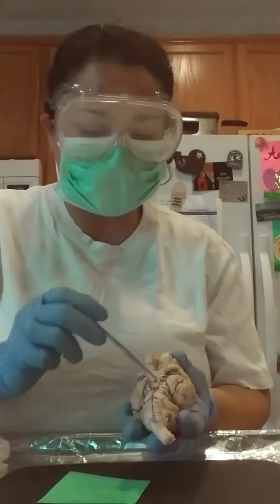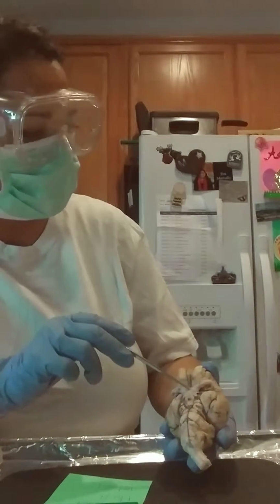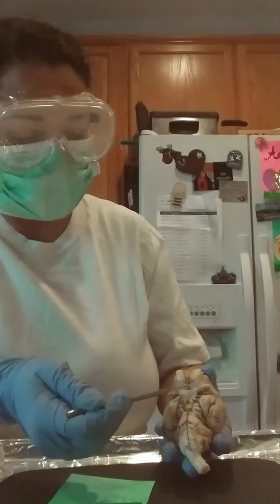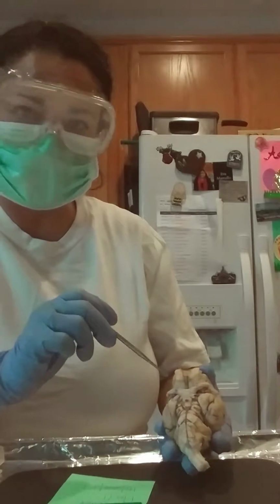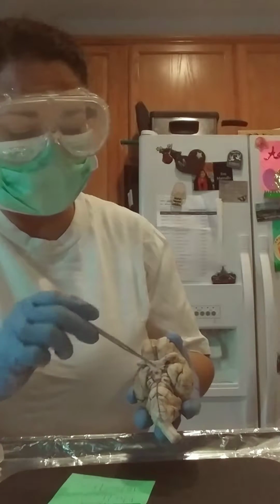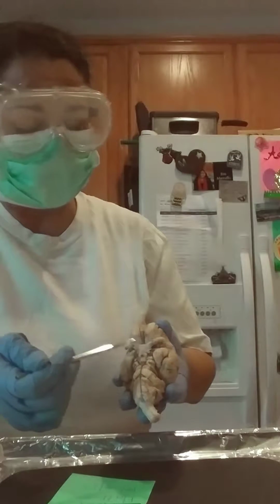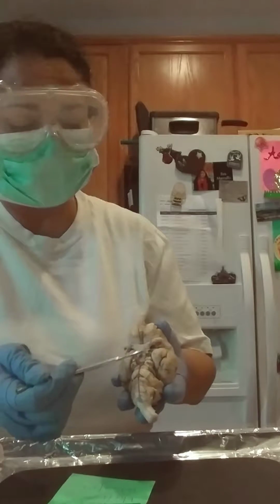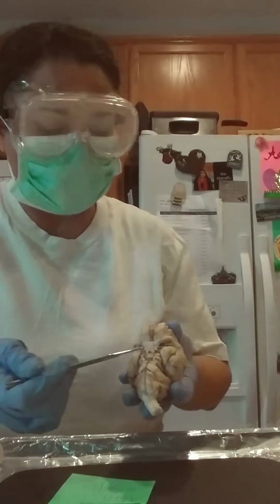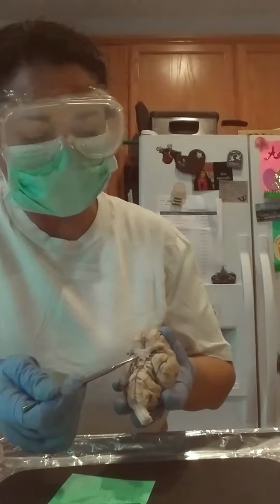And then here we have an X. I'm trying to see it this way, but we have an X right here, and that is our optic chiasm. Okay, these are our optic nerves, and they go into the eyeballs. The nerves come in through the optic nerve, and go through the chiasm out through the optic tracts. So that's where the X is. We have the nerve into the chiasm and to the tracts.